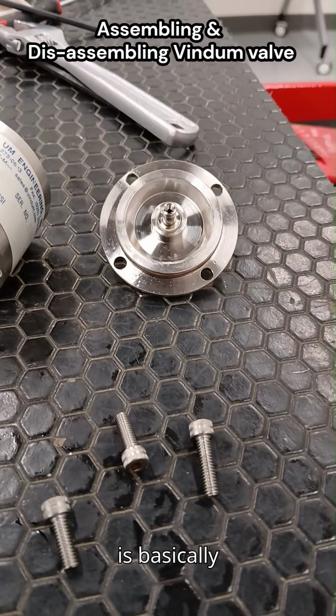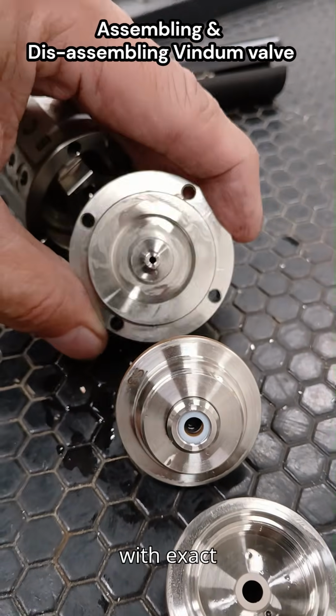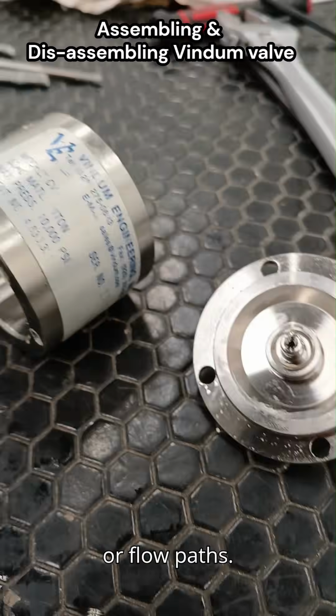Assembling the Vindum valve is basically the reverse of disassembly, but because these are precision high-pressure lab valves, the process must be done with exact alignment and care to avoid damaging seals or flow paths.